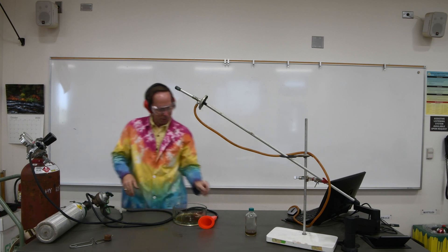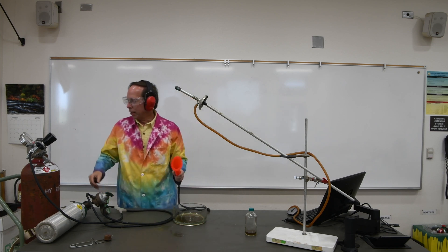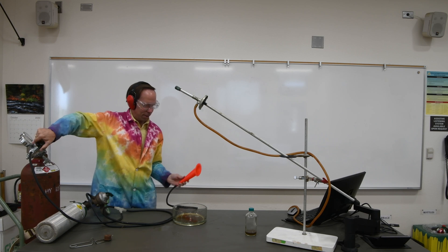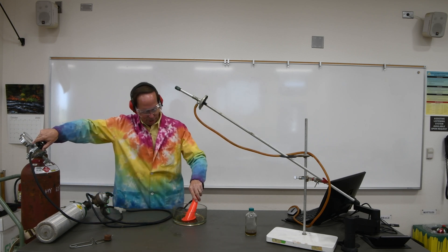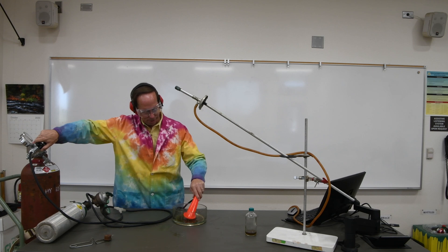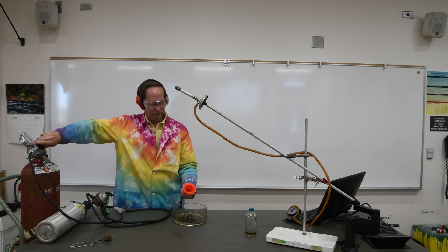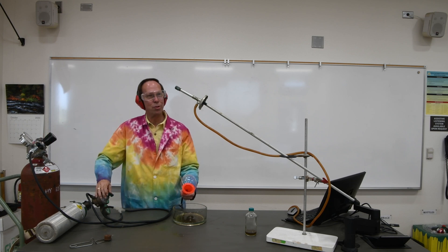Just to be safe of course, I am going to put on my hearing protection. There we go. So we'll start with the hydrogen. Let me just blow it out a little bit here. All right, so let's start out by putting some hydrogen in a bubble. This should be two-thirds. All right, now let's try some oxygen.